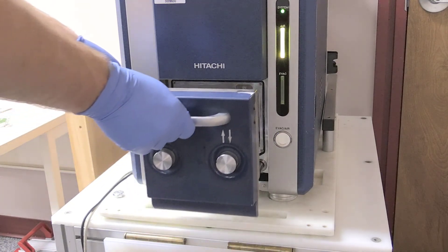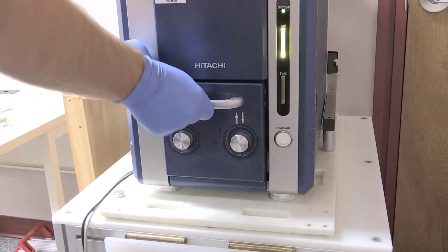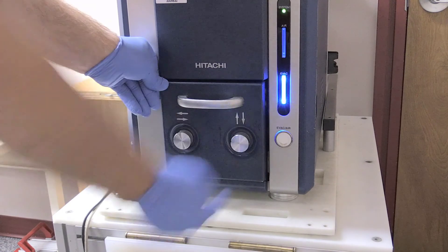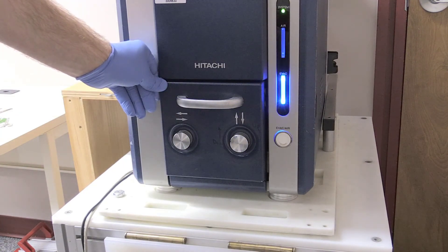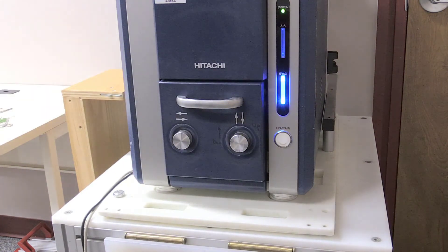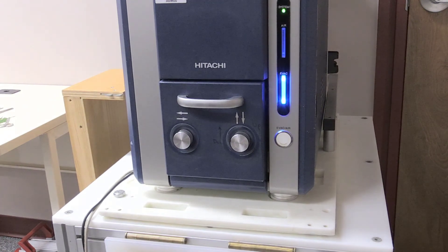Close the specimen stage and press the EVAC button while holding the handle firmly. It should start to blink blue and eventually become a solid blue color. Once it is, you're finally ready to go.